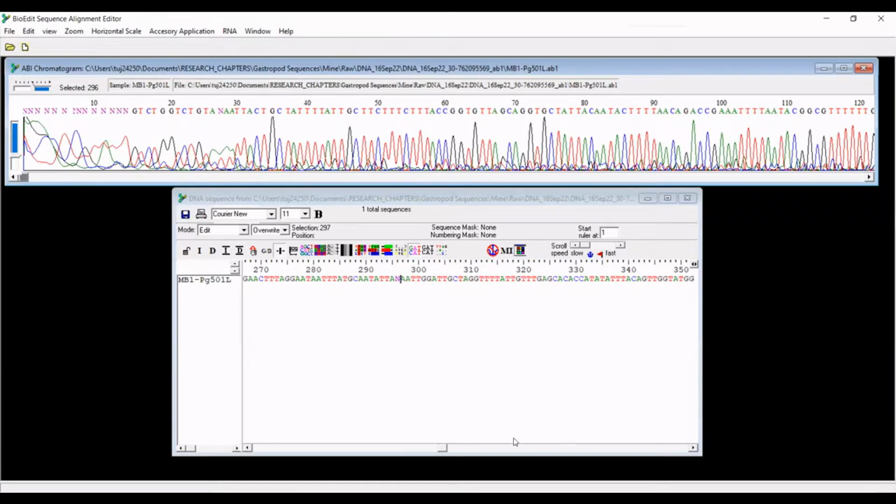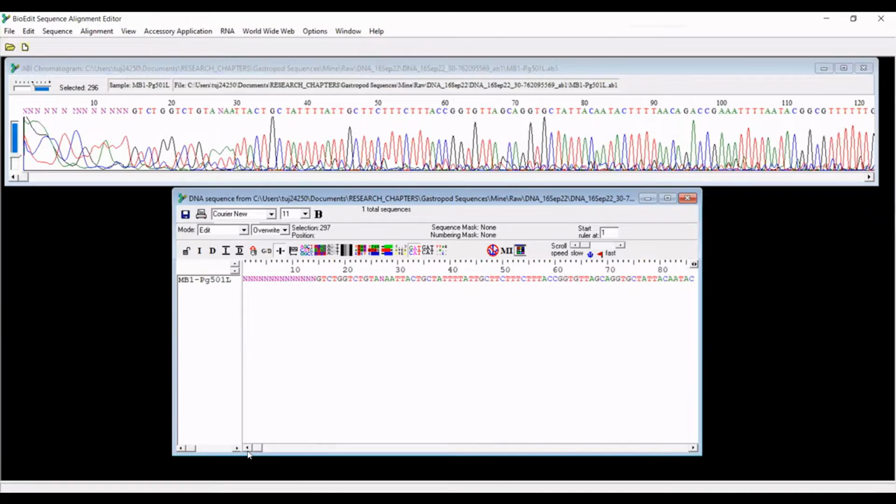Just like at the end of the sequence, the beginning of the sequence is also typically pretty messy, which you can see here. And so we also want to trim that off as well. You don't have to keep track of exactly what you're trimming to make the reverse read match. That will all come out when you align your sequences with each other. And so I am going to call it probably at base position 31. Okay, so everything before 31, I'm also going to trim. And so now I have my sequence, okay?